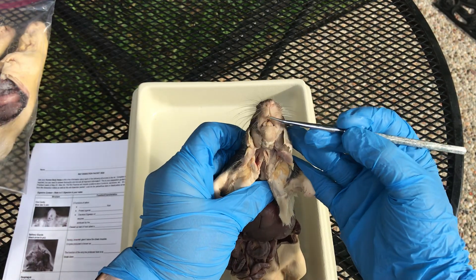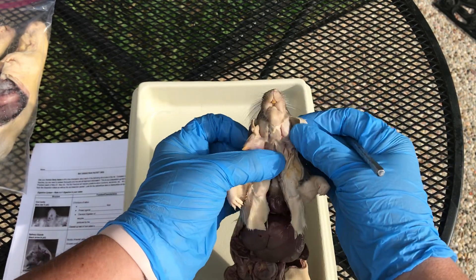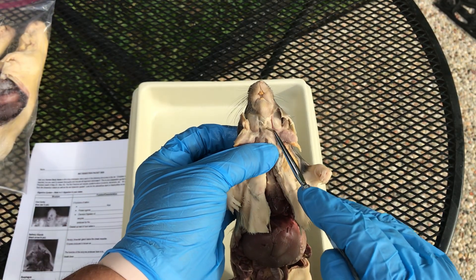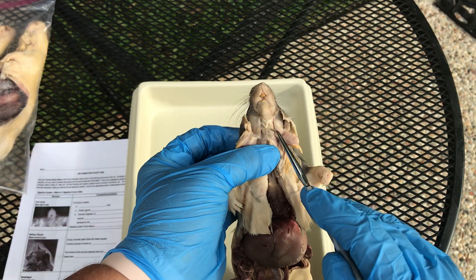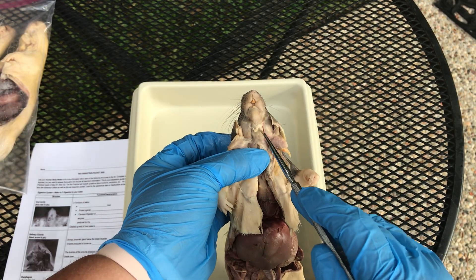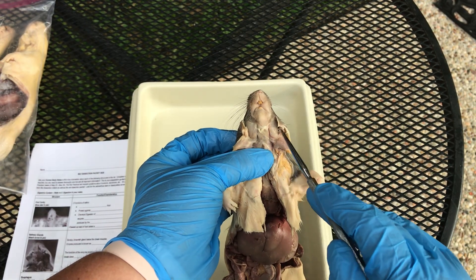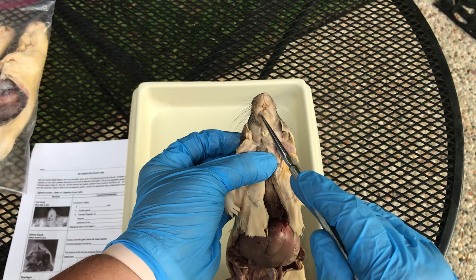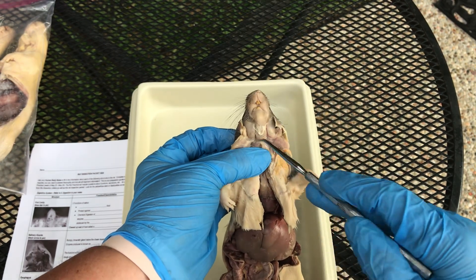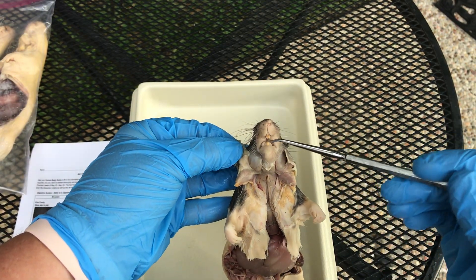With chewing, you have the teeth involved — these are incisors; rats have really big incisors used for gnawing. They also have muscles in the cheek area. These are called masseter muscles, and between them is called the digastricus. Both the masseter muscles and the digastricus work with mastication — that's the Latin word for chewing. The digastricus pulls the mandible down, and the two masseters pull the mandible up, producing the chewing action.